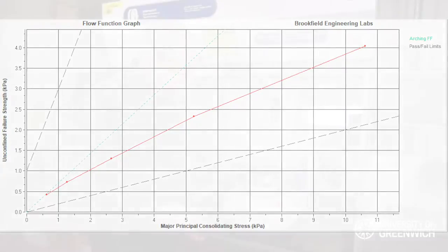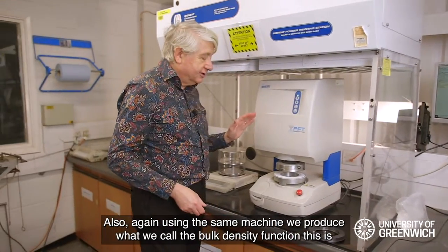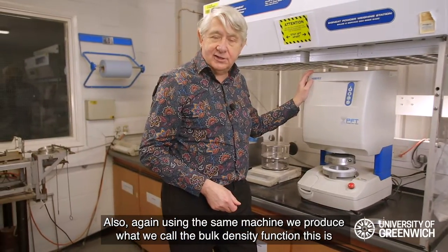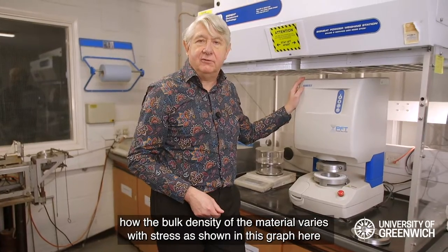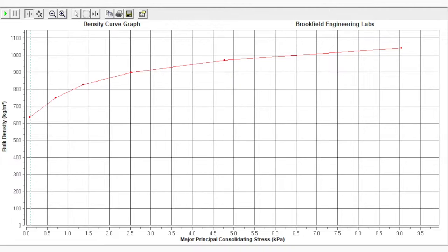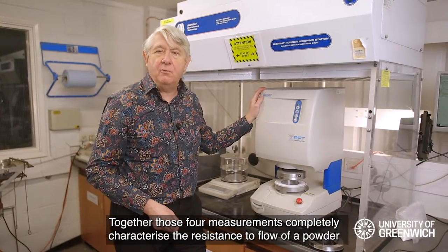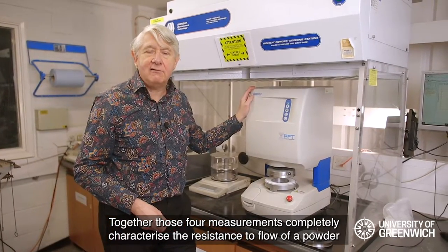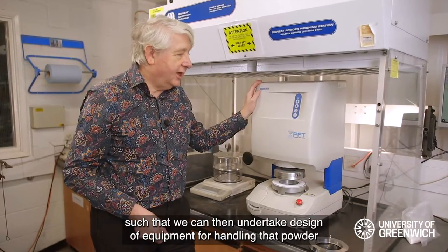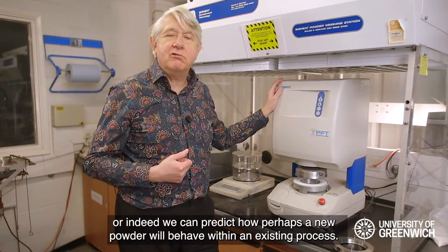Also using the same machine, we produce what we call the bulk density function — how the bulk density of the material varies with stress, as shown in this graph — and in addition, what we call the internal friction function. Together, those four measurements completely characterize the resistance to flow of a powder.